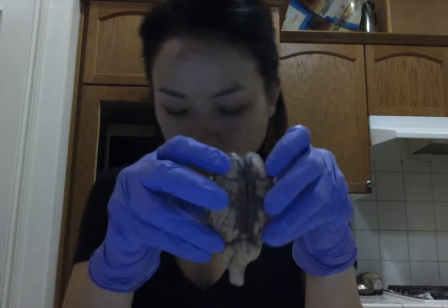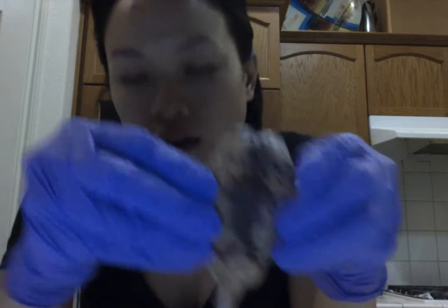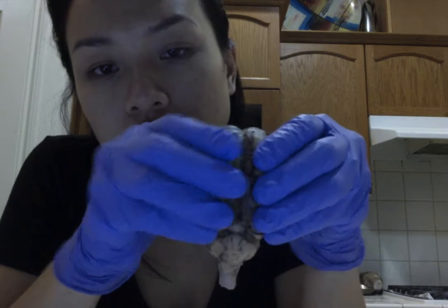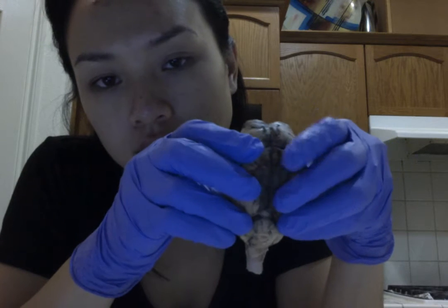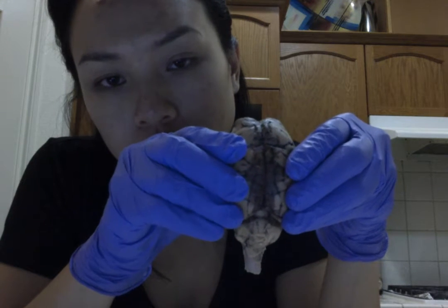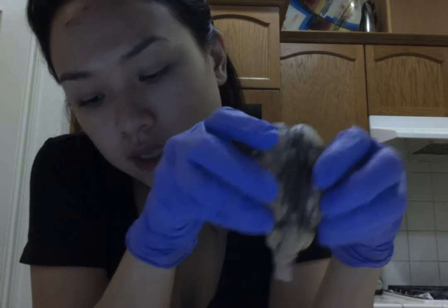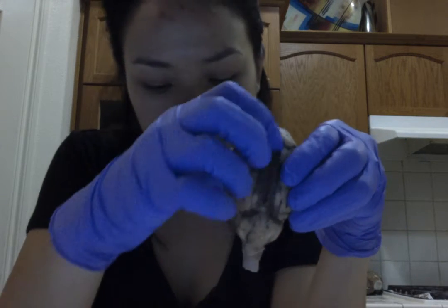anterior of the brain. The frontal lobe is also involved in smell, plus it handles a lot of motor function. Also on the dorsal view of the brain, we see this midline right here, which divides the cerebrum into two cerebral hemispheres, and this midline is known as the longitudinal fissure, right down here.